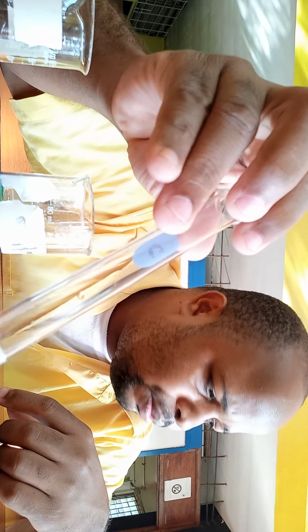Test tube C. So which test tube did I use?